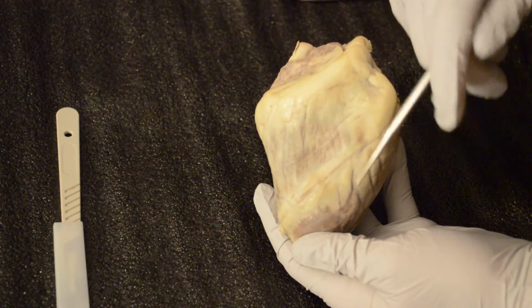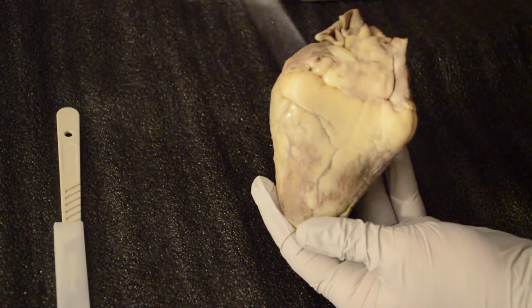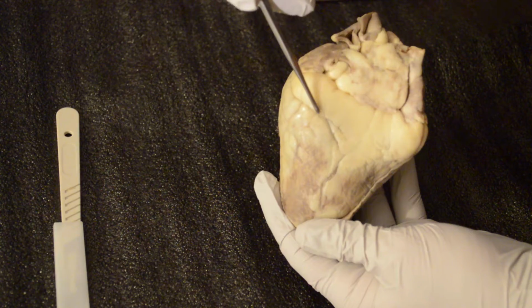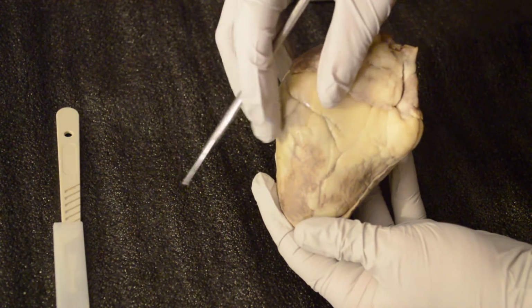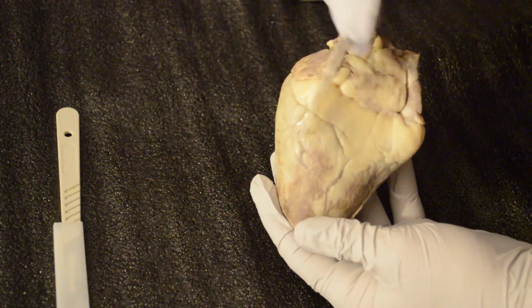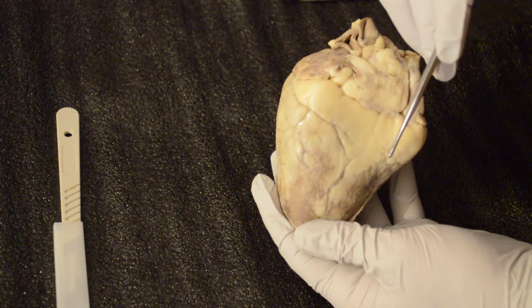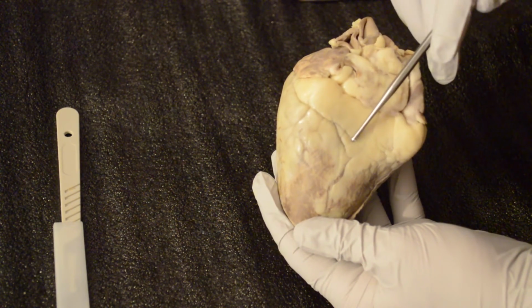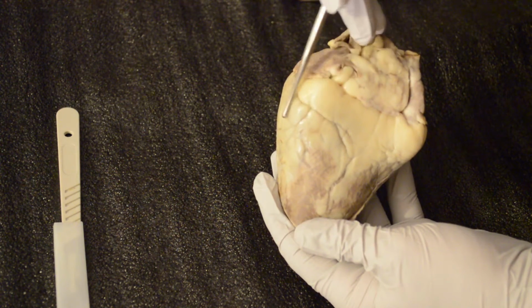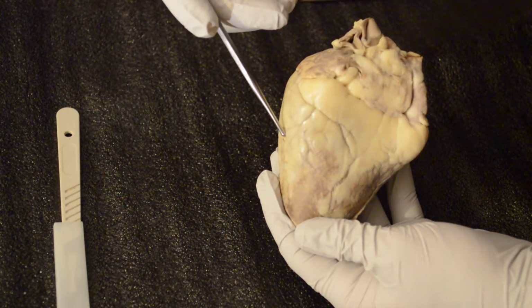Okay, all right. On the posterior side is going to be the posterior interventricular sulcus. That's going to be right along here, okay? That's also important. Why? Because it actually sits on the diaphragmatic surface of the heart, and it's going to be on the right margin. So on the right margin here, this is the left, this is the right. Okay, this gives you a little orientation on that. This actually feeds the great cardiac vein. The great cardiac vein goes along the side here, and can go around and situate itself right here along the side of the heart.